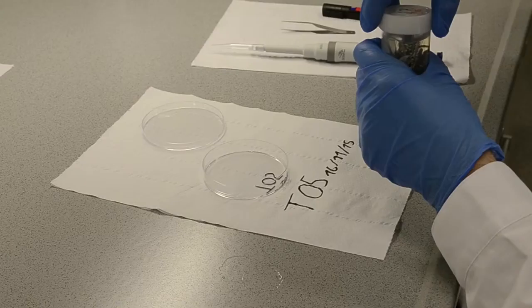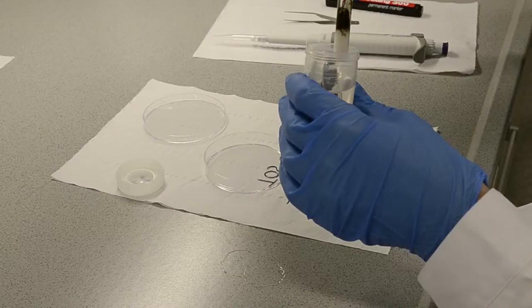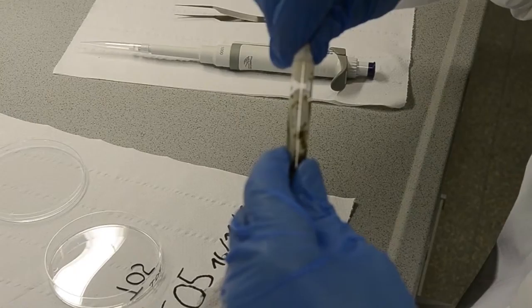Several kick samples were taken per sample site, which are all in individual glass tubes. However, for DNA extraction, all kick samples collected at a particular site were pooled together.